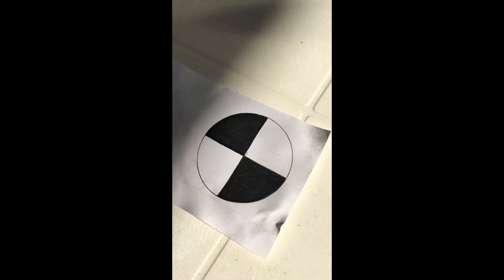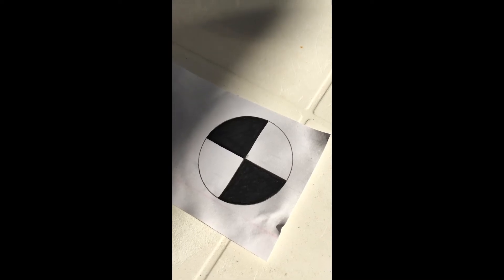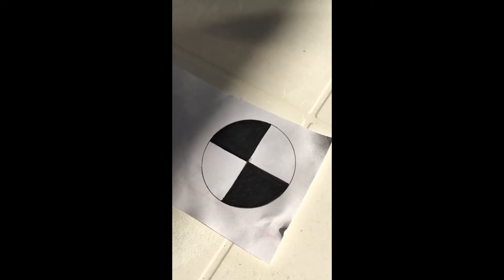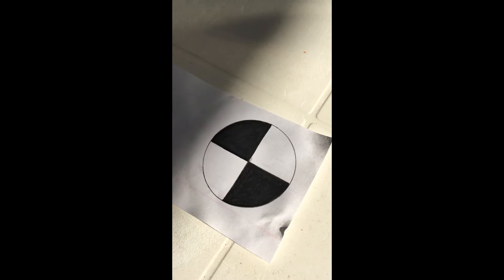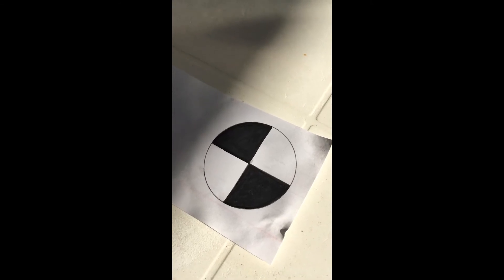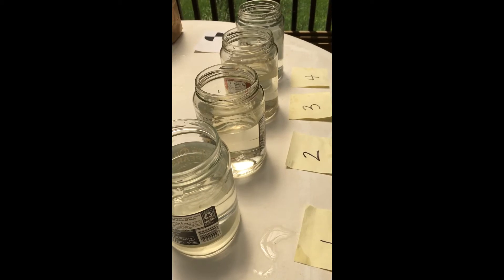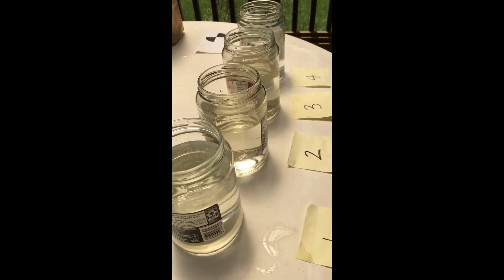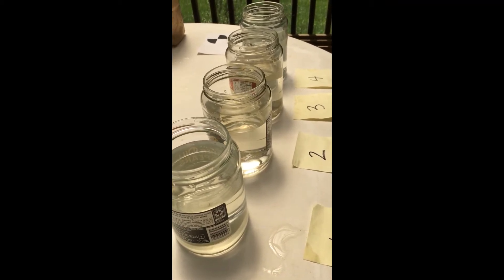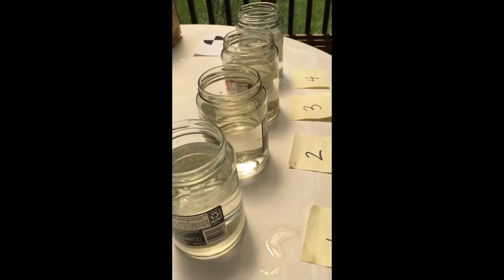I'm going to place this under each container to allow us to make observations about water clarity. For each container, write your day one observations on your data sheet. Now let's make observations about each of the containers. You may need to pause the video at each container to write your observations down.